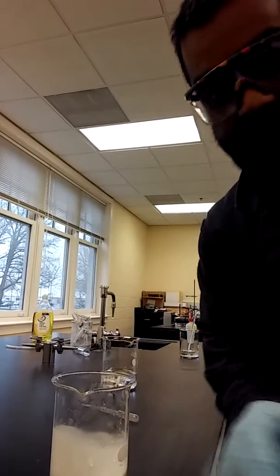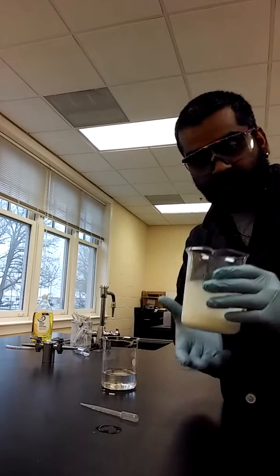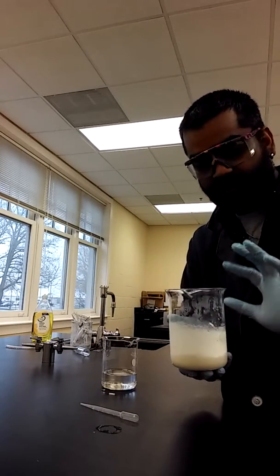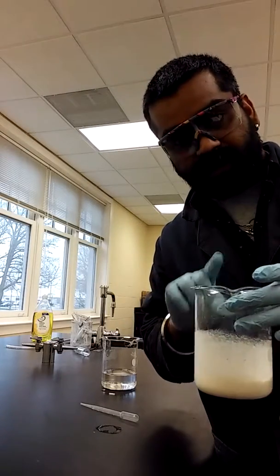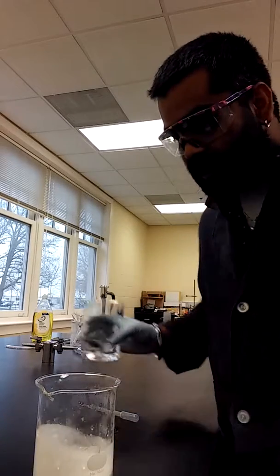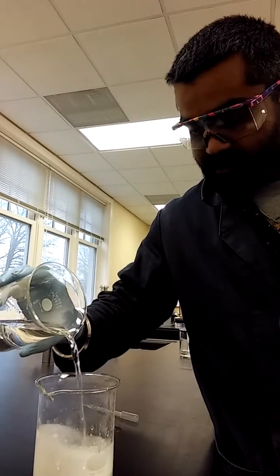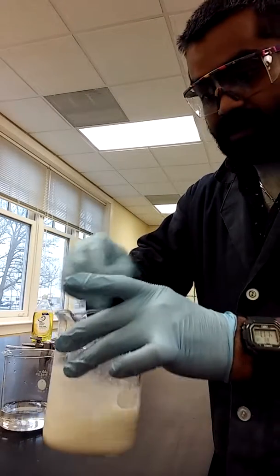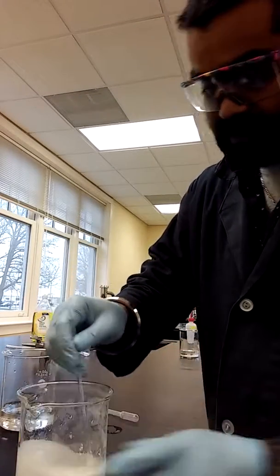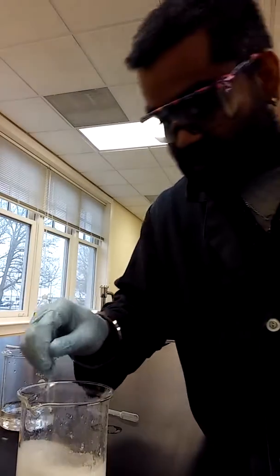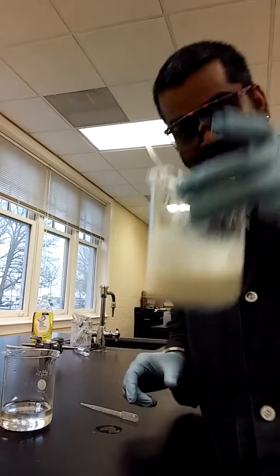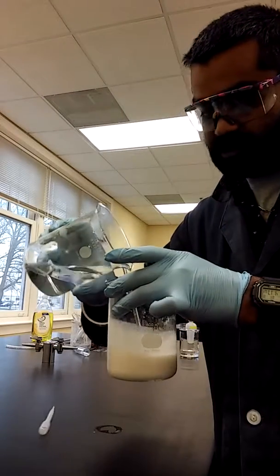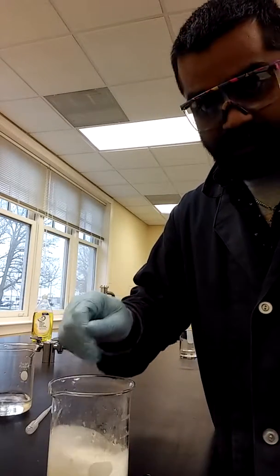All right. We're moving on to the last step in the process. So if you notice on part three, the precipitate that was left on the bottom was yellow in color. So I separated it out through filtration. So the liquid came. Still, this was yellow in color. But when I added the sulfuric acid, it turned white. So you can see it, it's no longer yellow in color. It's basically how much you add depends on if there's traces of yellow color still stuck to your solution. But to me, I think it looks pretty good. I'm just going to add some more as always for good measure.